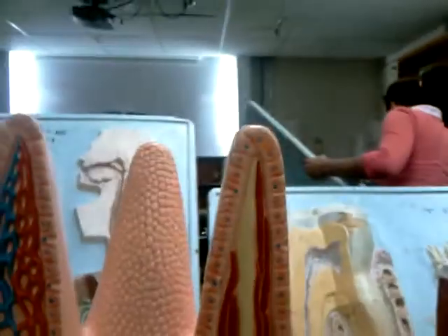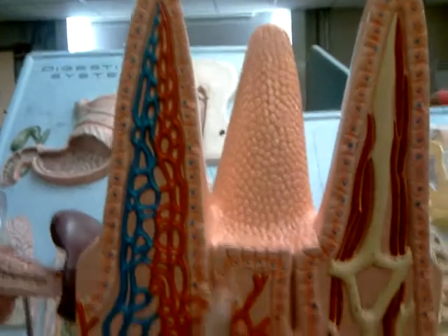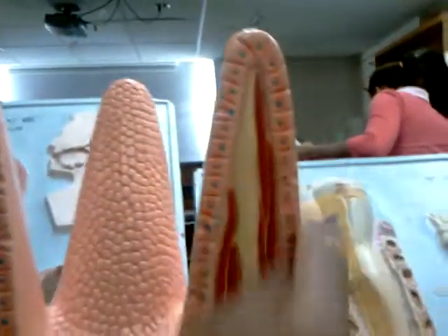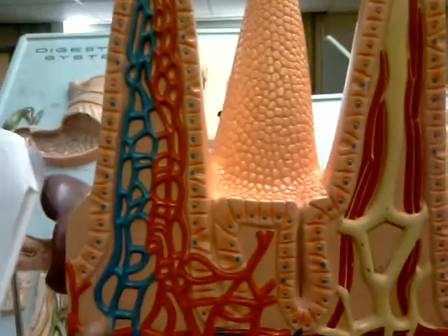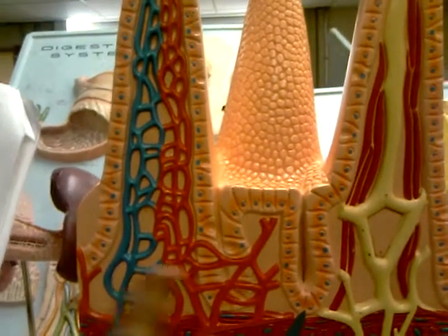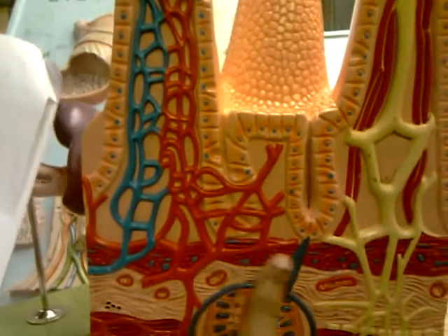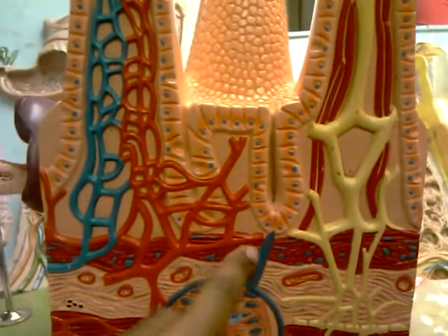And then these are your mucosal epithelium, which lines it. And then your lamina propria would be the peach stuff back here behind your capillaries and stuff. And then the muscularis mucosa would be here, this last lining.